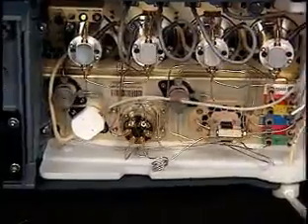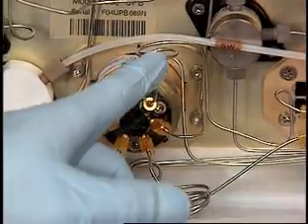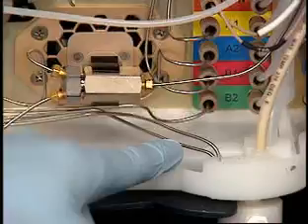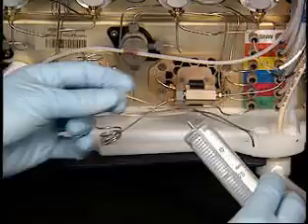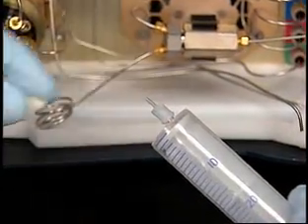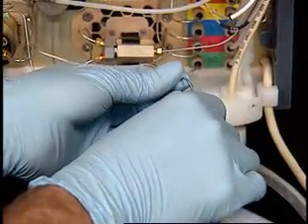To prime the binary solvent manager, locate the appropriate solvent vent line. If you are priming solvent B, follow the stainless steel vent line from port 1 on the vent valve; port 4 for priming solvent A, and lift it out of the drip tray. Connect the tubing adapter and tubing to the syringe, and then connect the syringe assembly to the solvent vent line.